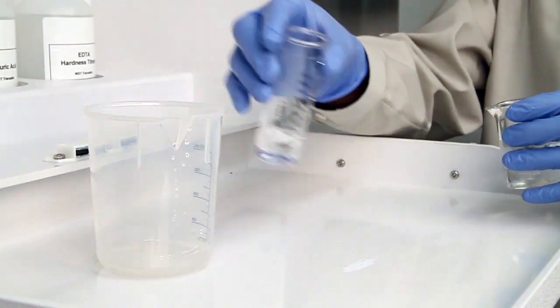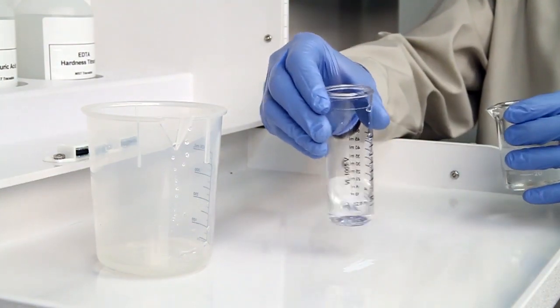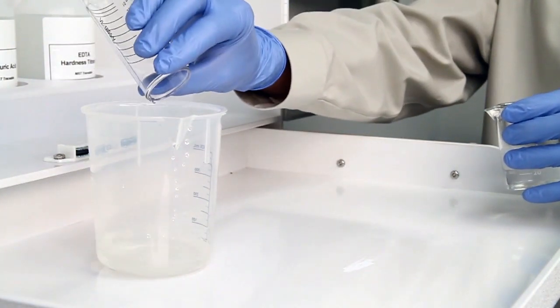Before collecting your sample, it's important to rinse the vial three times with the sample to be tested. This minimizes the chance of contamination from a previous titration.